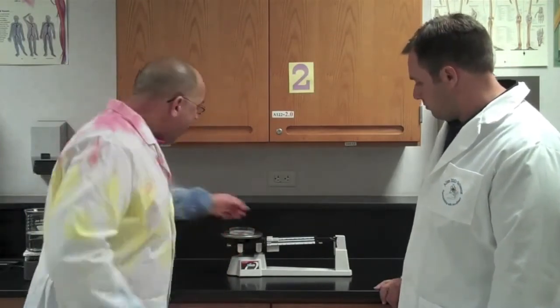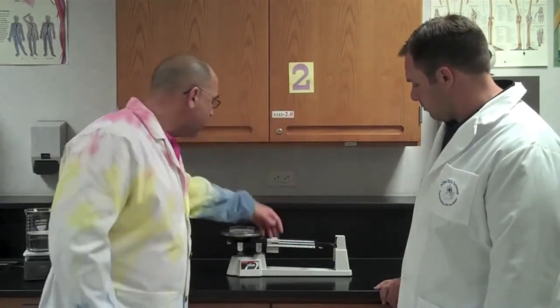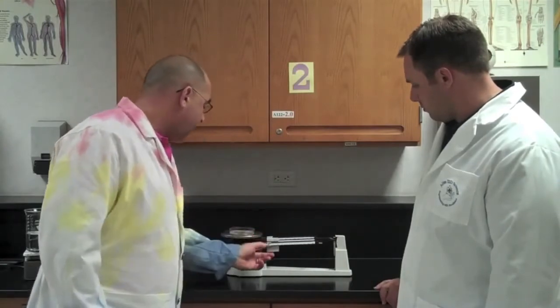So we're going to get the mass of this. I'm using a petri dish to hold the golf ball. But when I put the petri dish, the petri dish sets this out of zero. So there are two ways to do this. Find the mass of the petri dish first. That's the 10 gram line at the back and you can see how it drops down. So I know it's way less than 10.